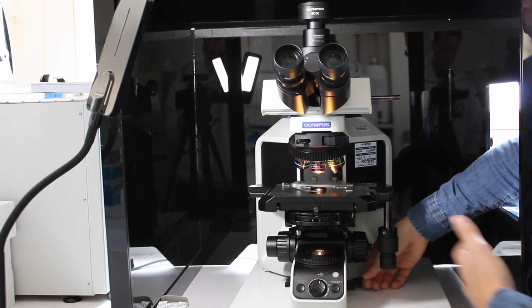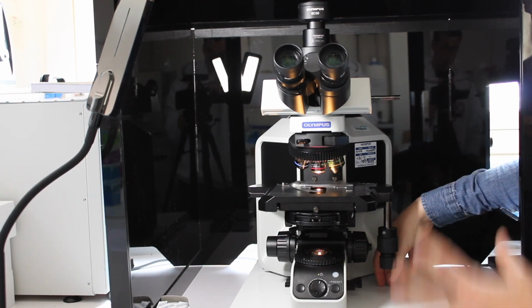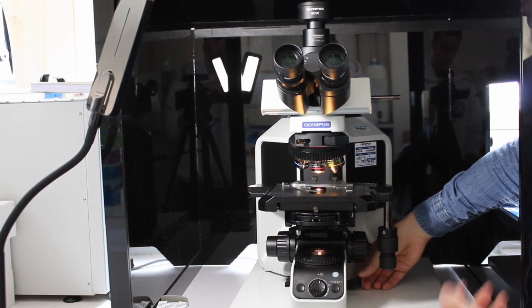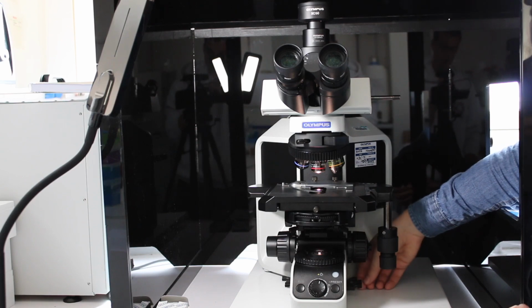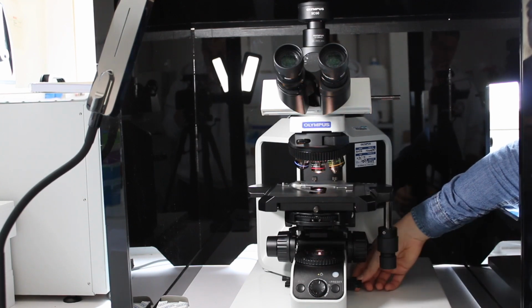If it's open, meaning pulled out on this side, the sample is irradiated with the spectrum from the lamp directly, which is not the spectrum of the sun. So if you want the real colors and to observe your sample as if it was under sunlight, you need to close this filter, so pull it in on this side. You see that the color of the light actually changes.